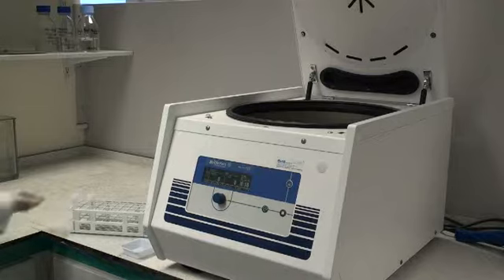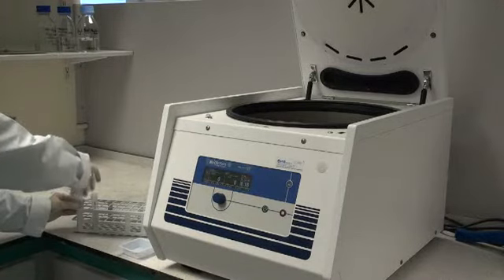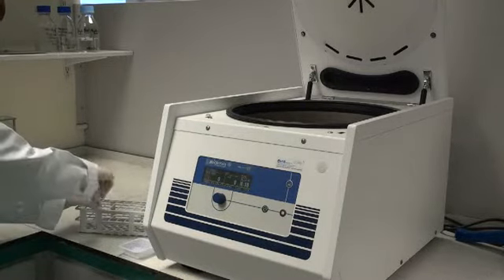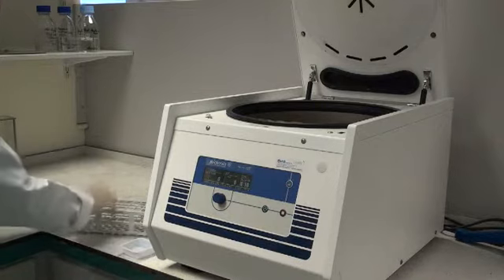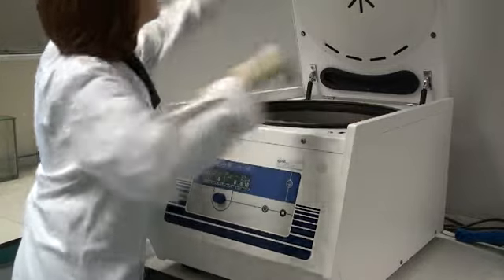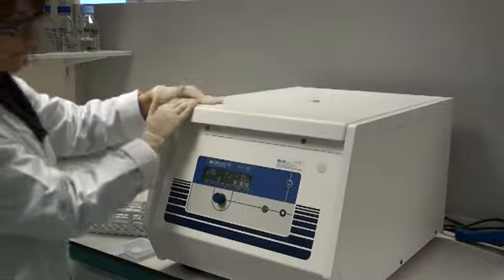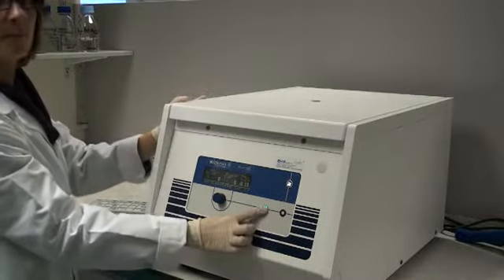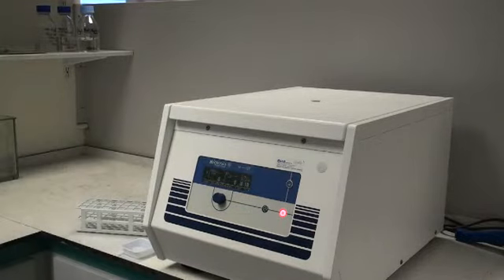Remove the caps from the extraction tubes, then place these tubes into a bench centrifuge and centrifuge at 1,800 g or 3,000 rpm for approximately 10 minutes.